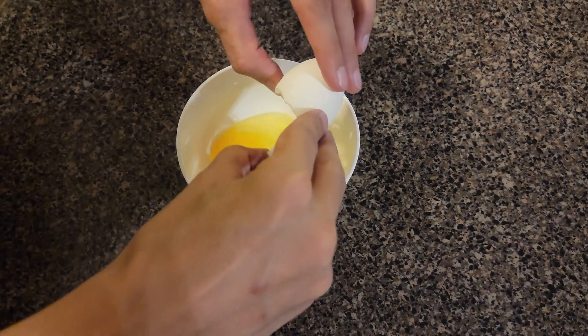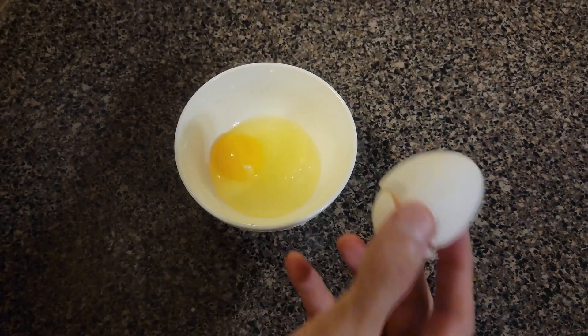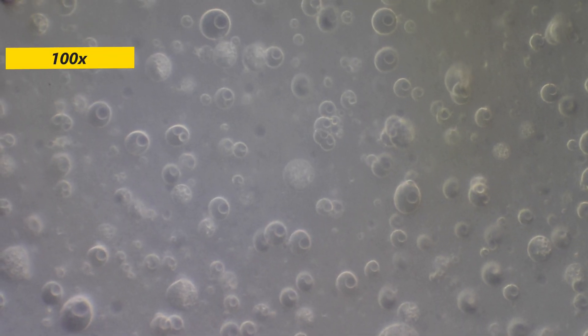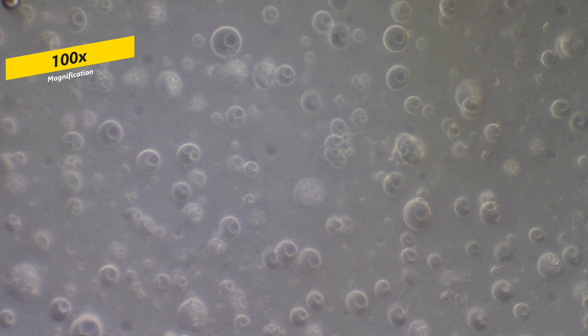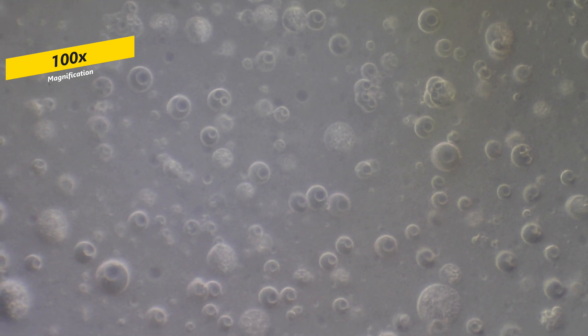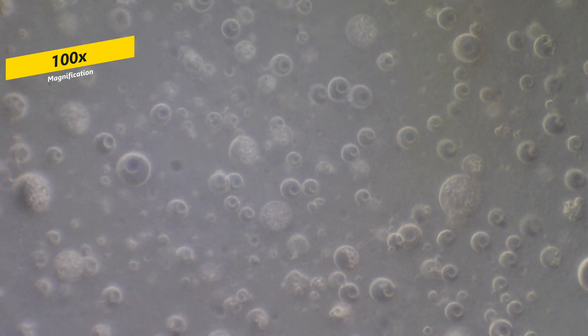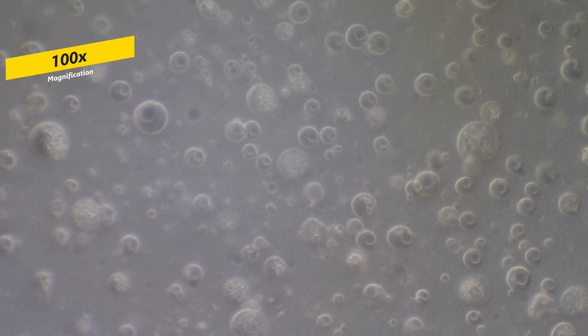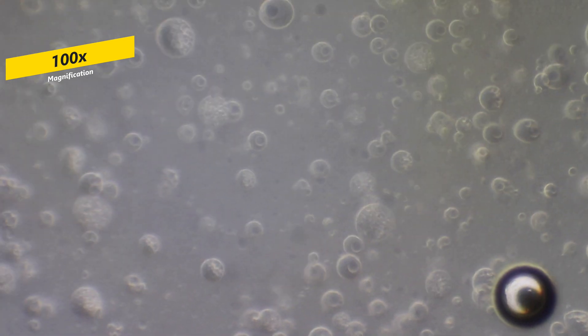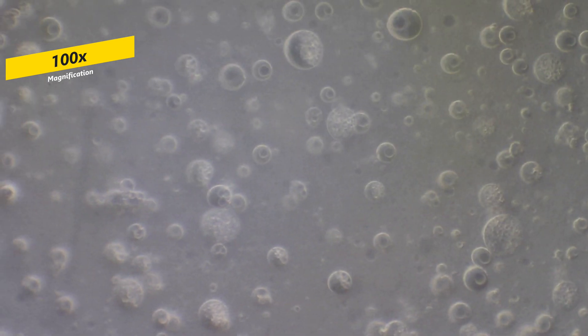Let's look at this egg under the microscope. We'll start off with the yolk. An egg yolk contains various amounts of protein, cholesterol, and nutrients, where the yolk in particular contains all of the fat and cholesterol.